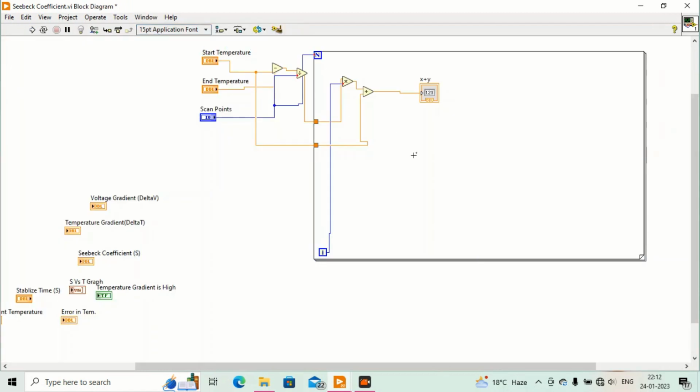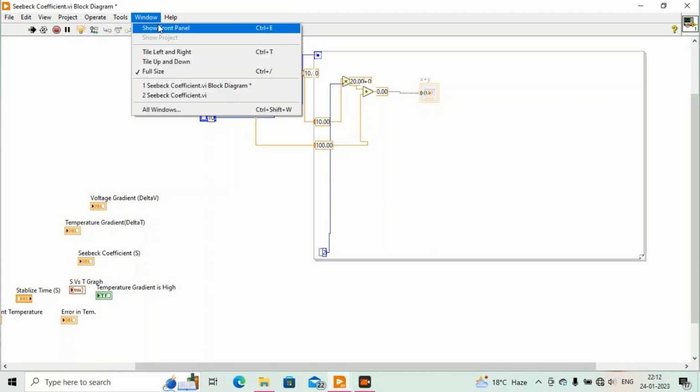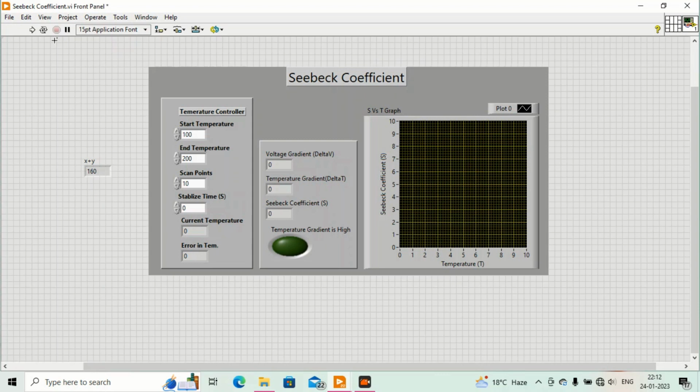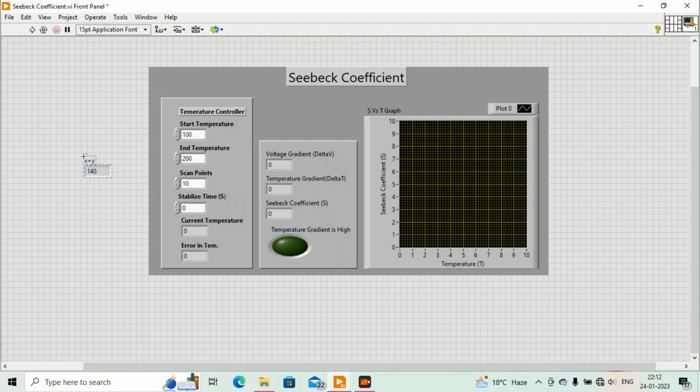So in reverse order. See, this is changing from 140, 50. You may run it again, like it's 100, 110, 120. So it will go on. Okay, it's good, it's working. So that's all we wanted.